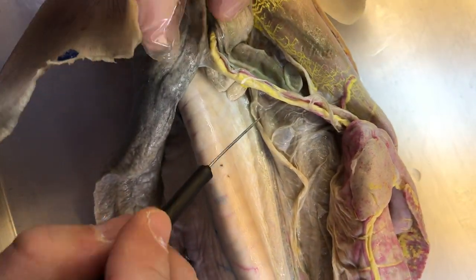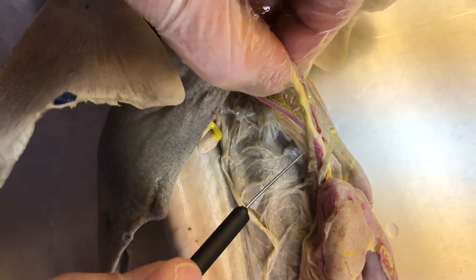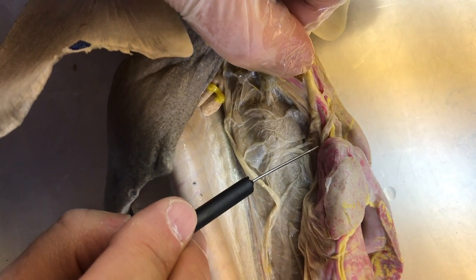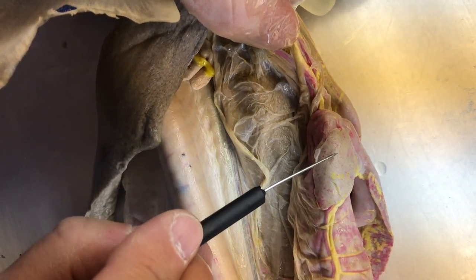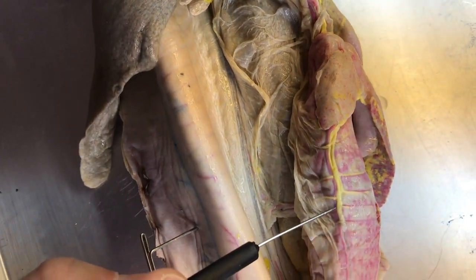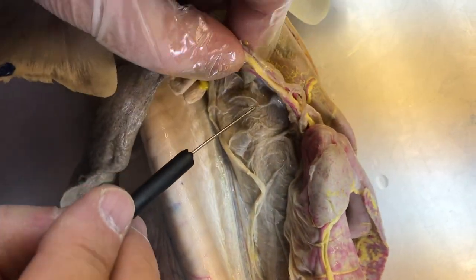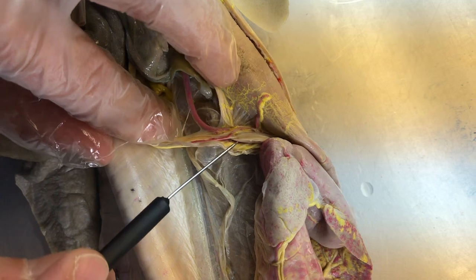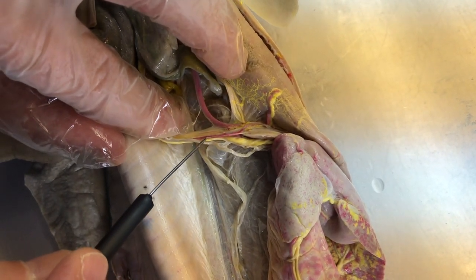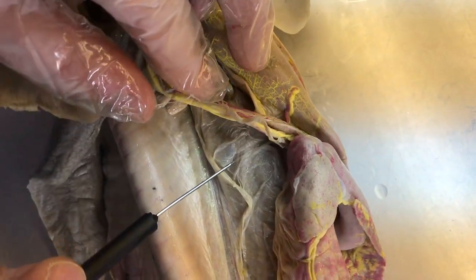Okay, so as a review, the first major artery coming off is the celiac artery. That will have one branch into the pancreatomesenteric artery. Again, there will be a branch that goes off to the duodenum, a branch off to the ventral lobe of the pancreas, and then it will continue on as the anterior intestinal artery and the annular arteries. Also, the other branch off the celiac will be the gastrohepatic, and that will divide into this small hepatic artery going to the liver and the gastric artery going to the stomach.